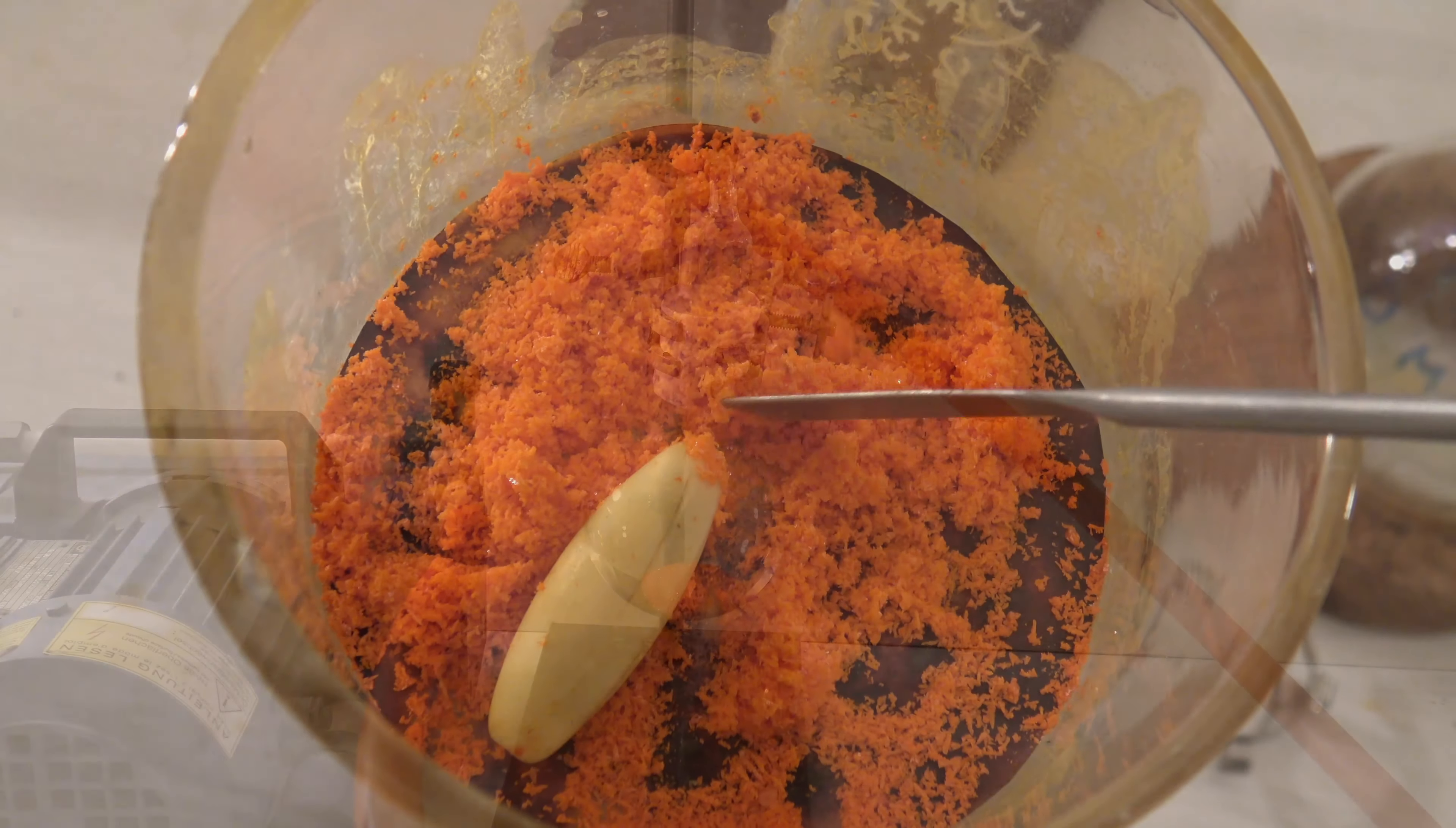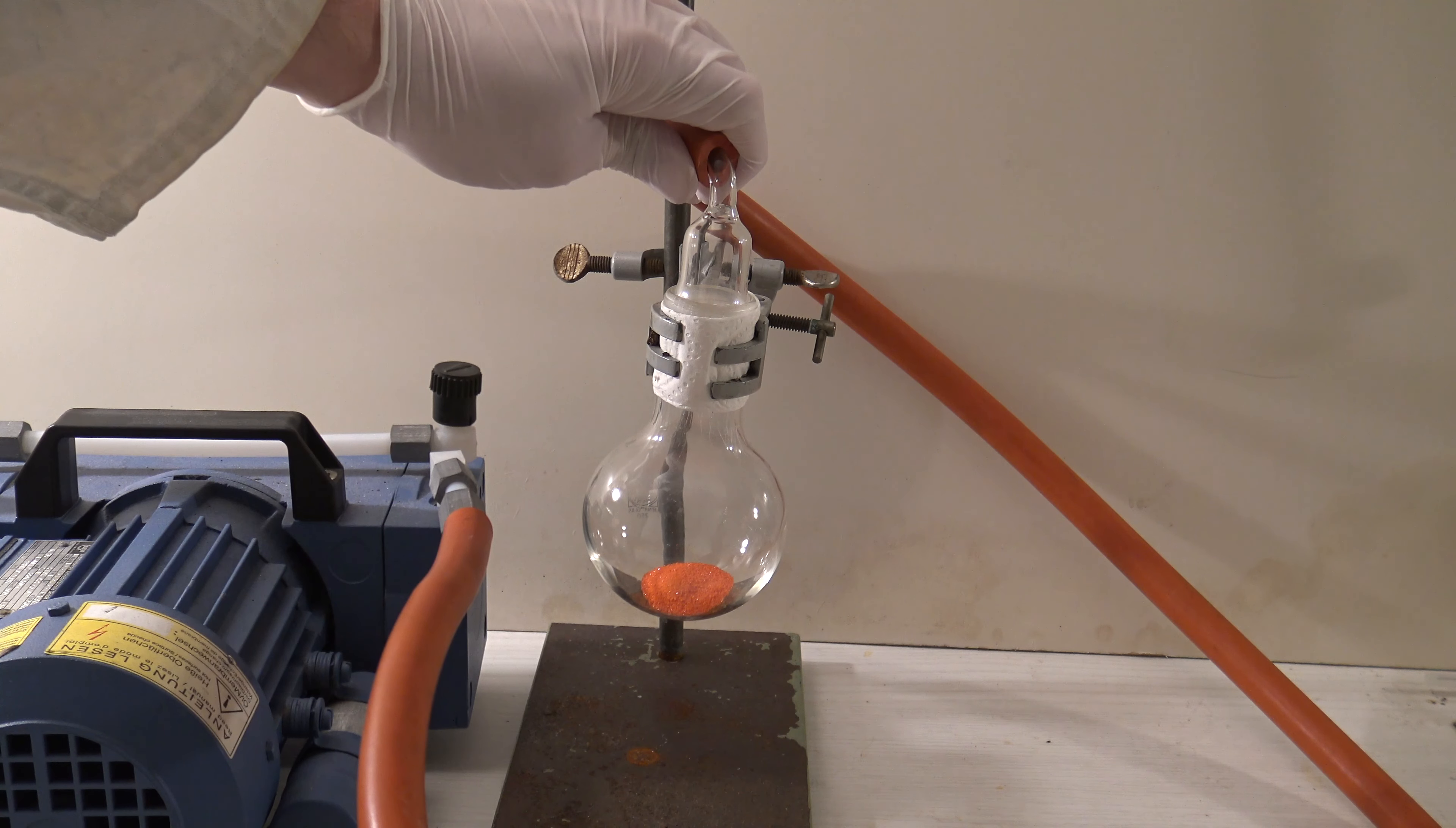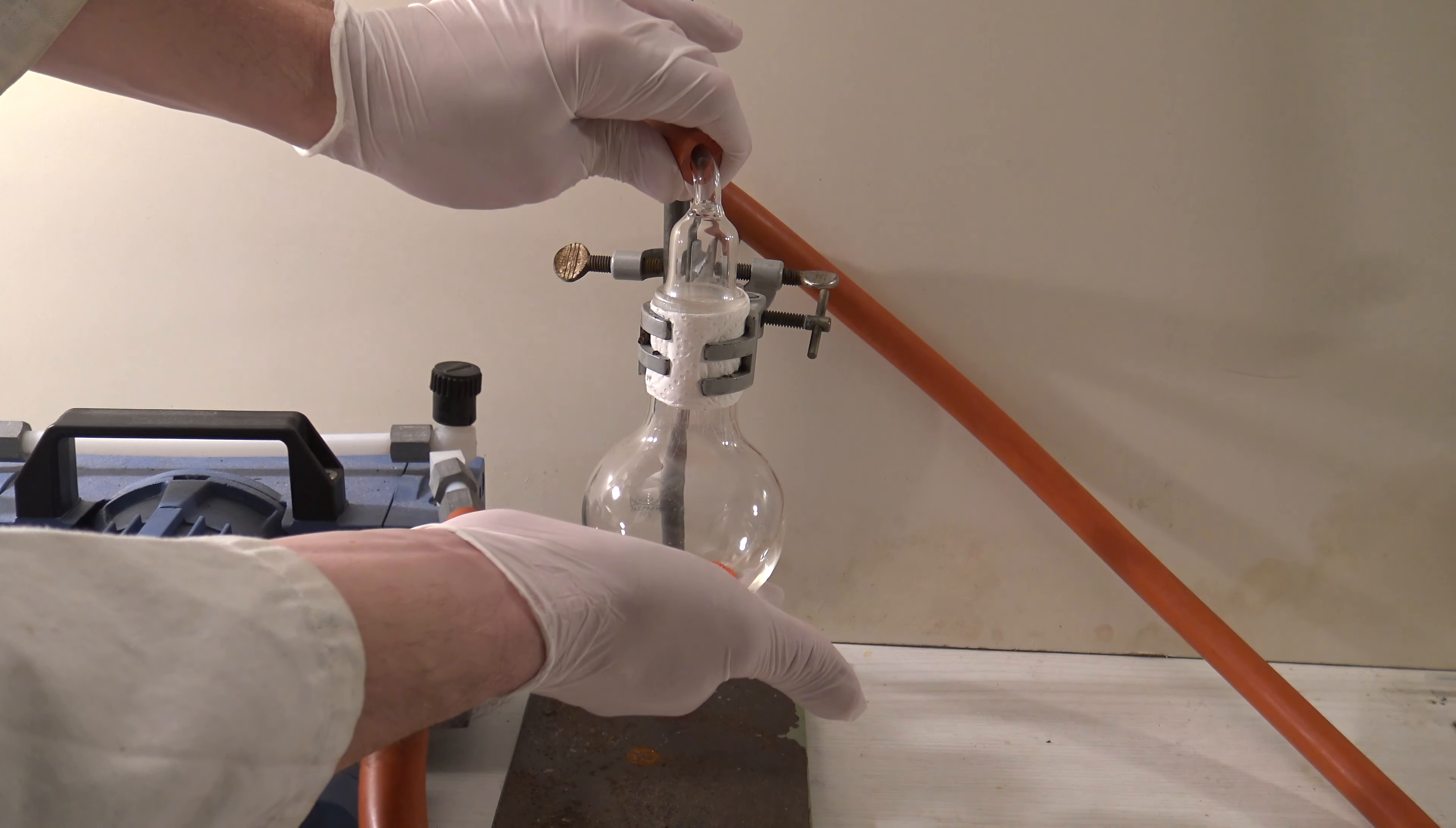When the crystals had dried on air for a bit, they were dried in a vacuum. The evaporation of the solvent should cause the flask to cool down, which didn't happen, so it was obvious that the solvent had already been removed.